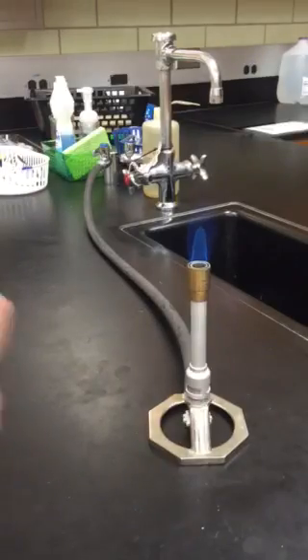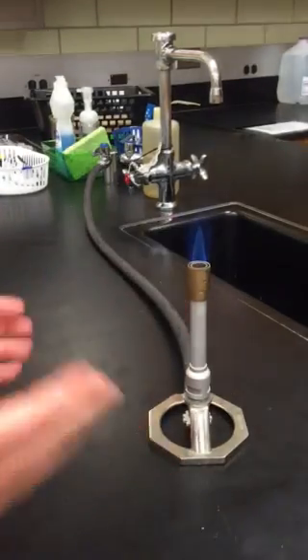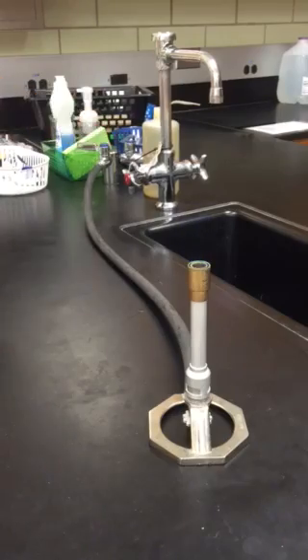It's going to be clean for us. It's not going to create soot or anything else — no incomplete combustion. Now I'm ready to turn my burner off. I can either shut the gas valve off, or the quick way I like to do this is to shut the gas off at the jet.